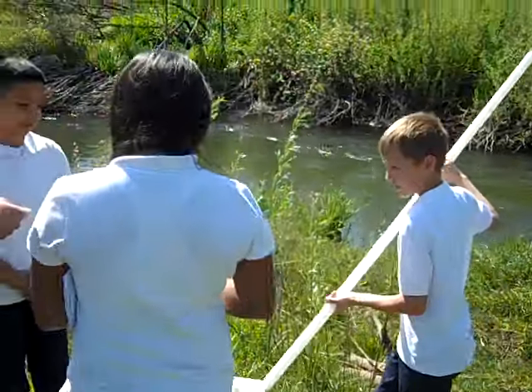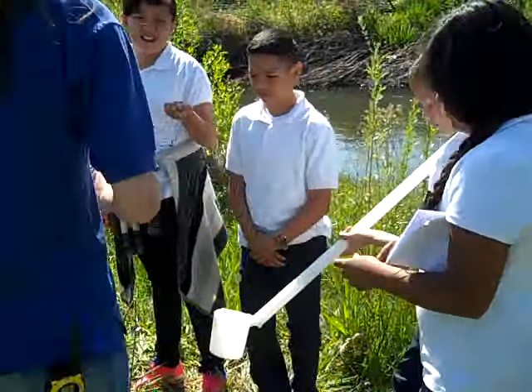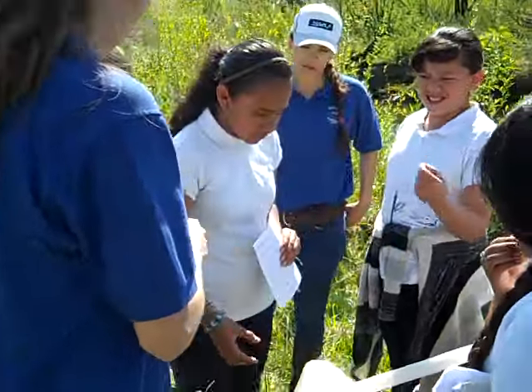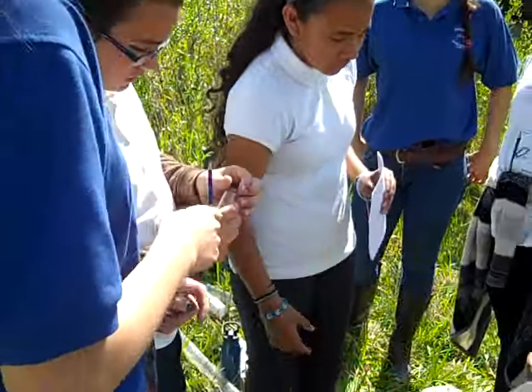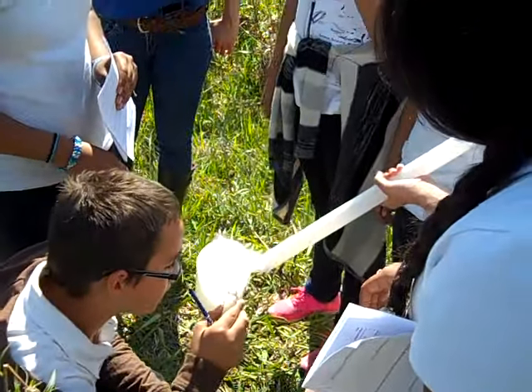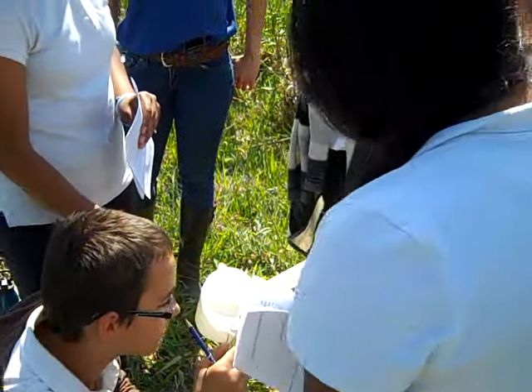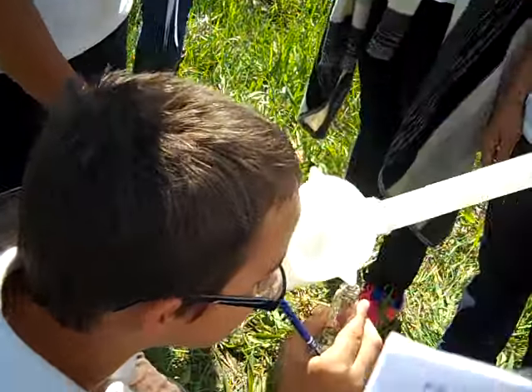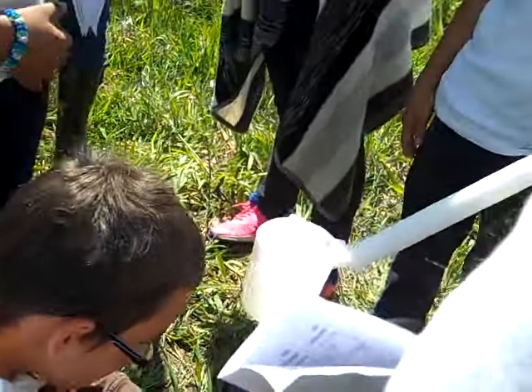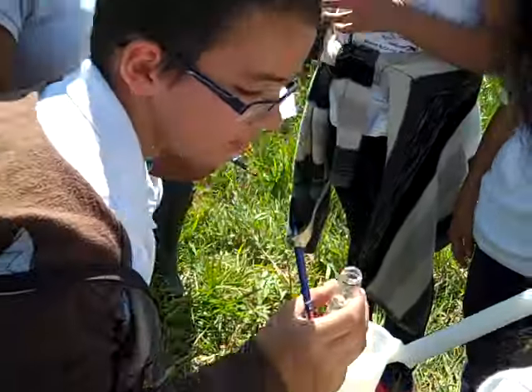Here, I'll take those pads. Alright, then you're gonna fill it up. You can look up there, and you're gonna fill it up to that line in the middle there. That's 10 milliliters of water. Be careful. Oh, a little bit over. Okay, that's good. That's alright. So put the cap back on.